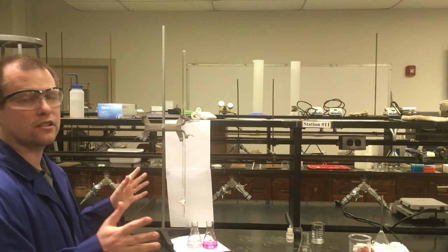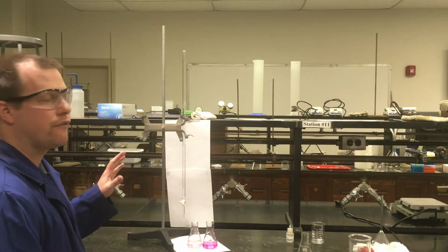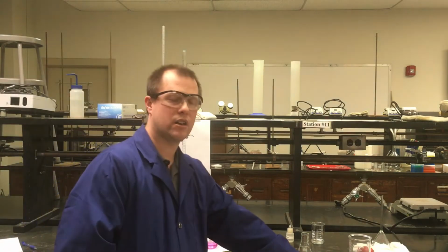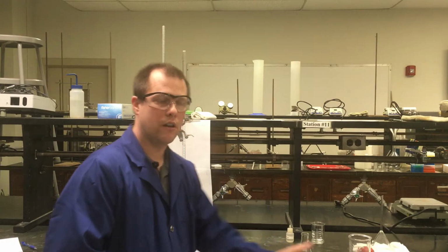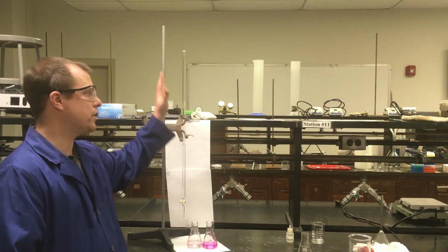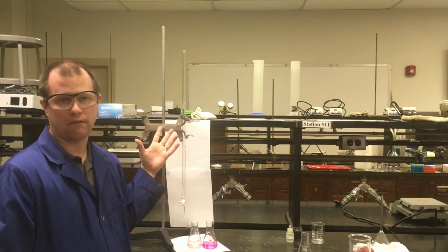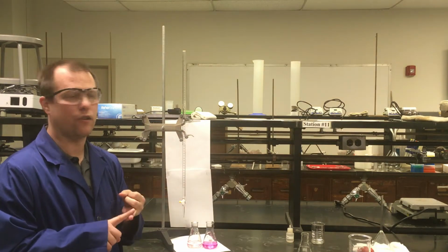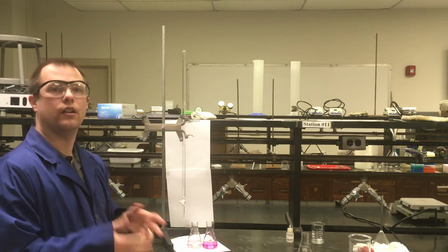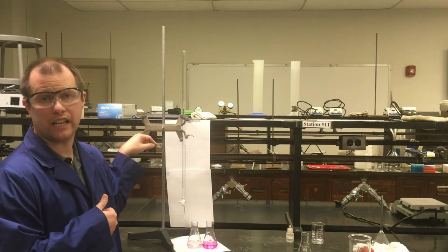Now, a few things in general about titrations before I get to demonstrating the experiment itself. For most titrations, our goal is to have some unknown concentration that we're starting with. And then for our solution that we're going to be putting in our burettes, we know the concentration of it, and we're using the burette to measure the volume of it that we're going to add. And by knowing the concentration and the volume of what we call our titrant that we add during our reaction, that lets us find the moles of the titrant that we're adding. So in this case, we have a way to find moles of NaOH.